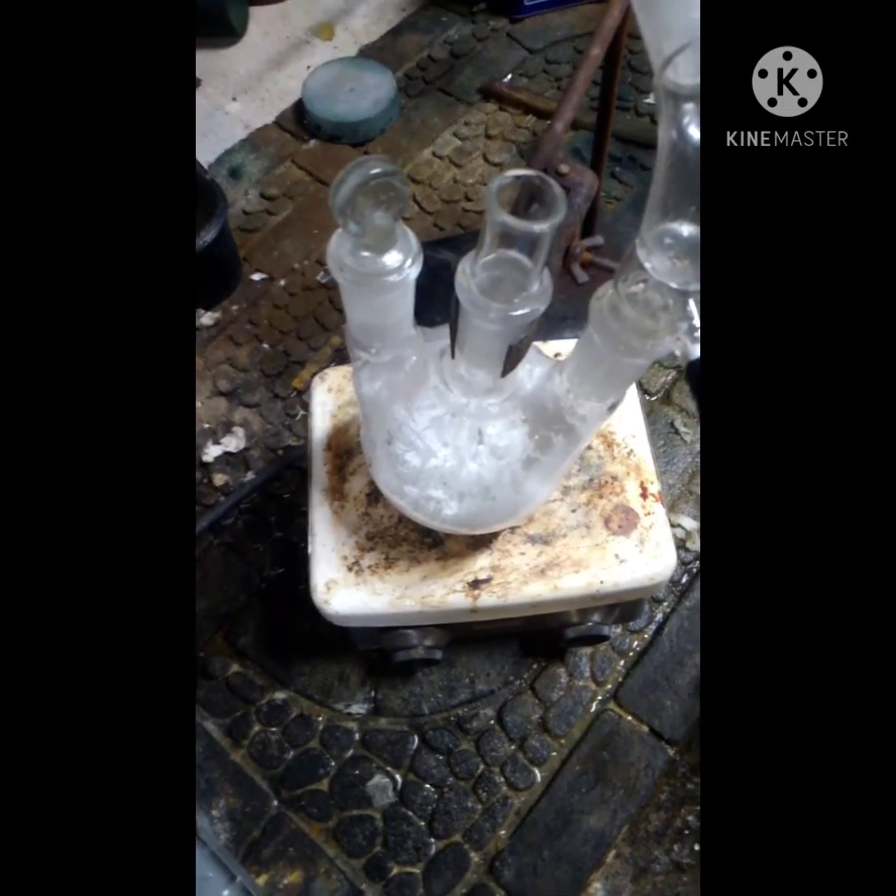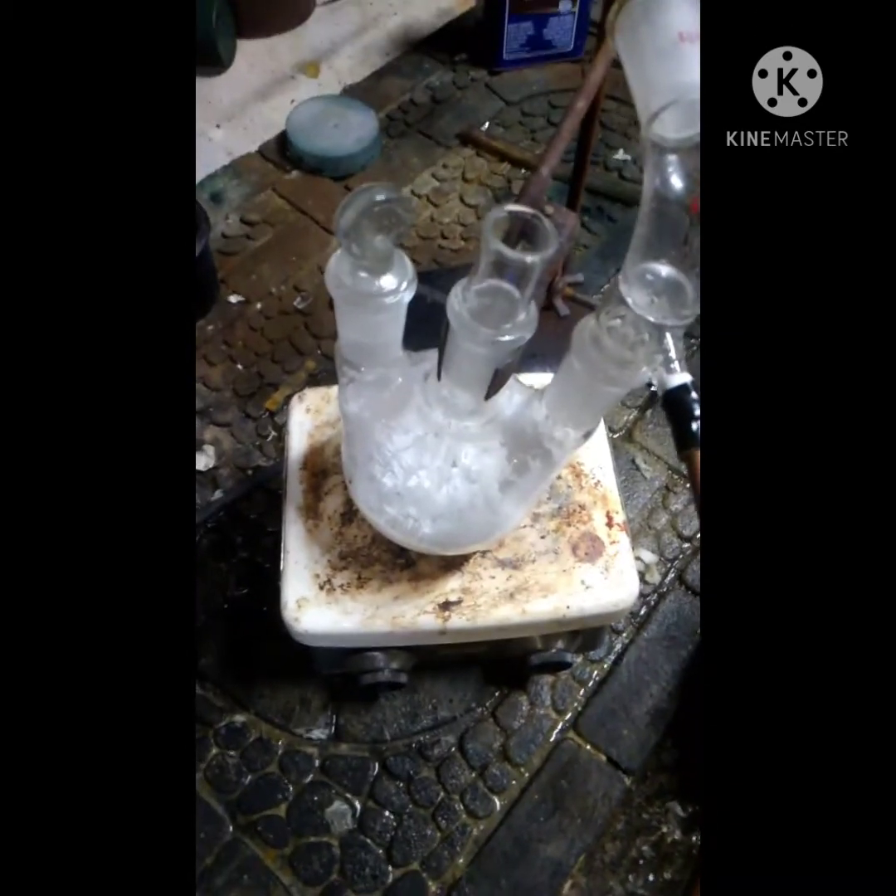When I get back in the morning it should be about done. Then I'll have to scrape it out and put it into another container and we'll take a look at it then.